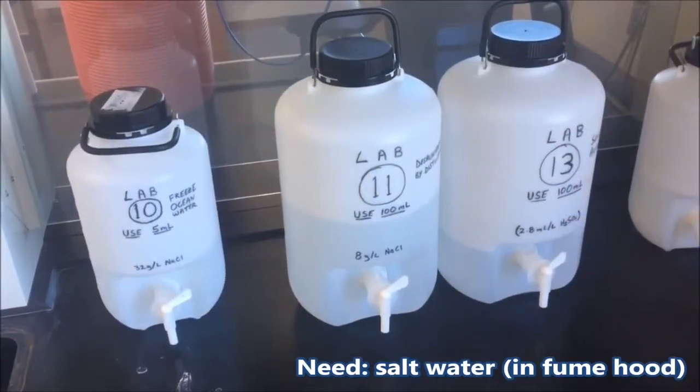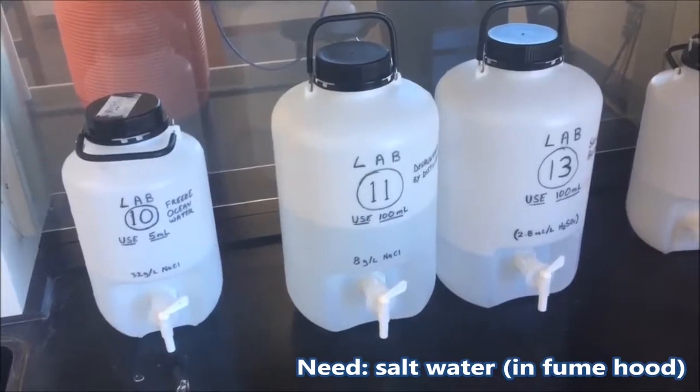We will also need salt water which can be found in the container in the fume hood and we're also going to need a pair of goggles that can be found in the back of the room.